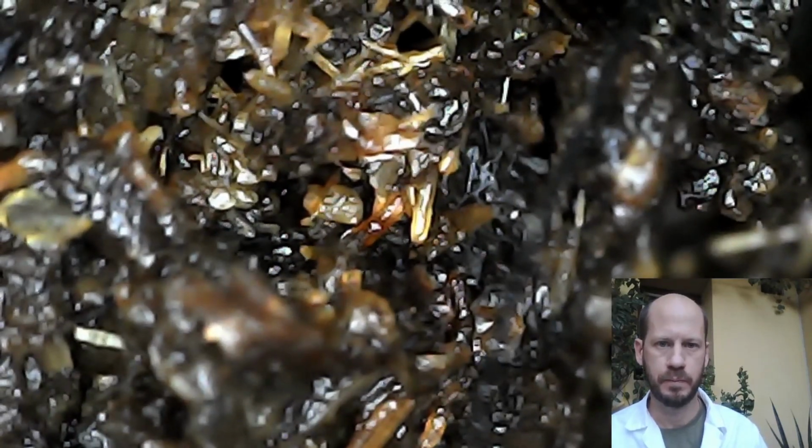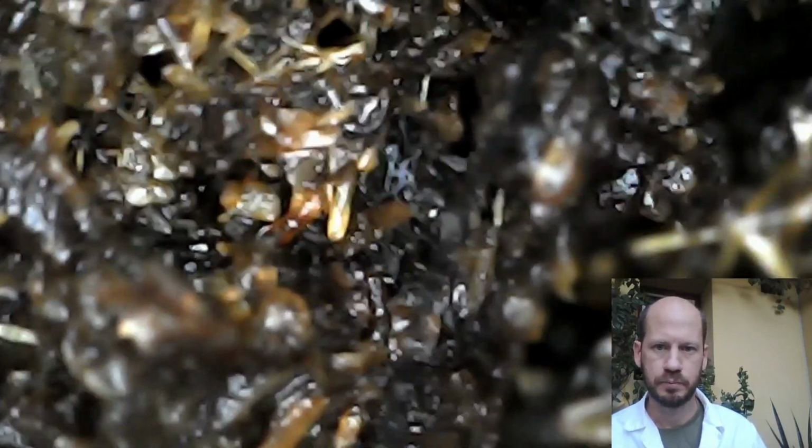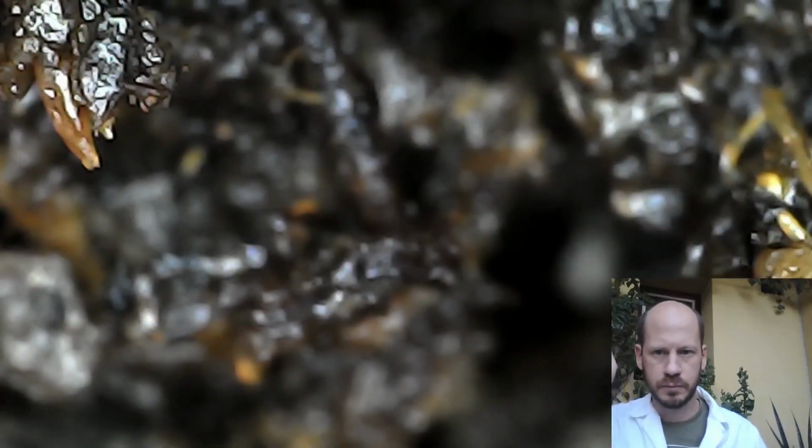And I will poke around here and try to find some life on this soil. You can focus up and down. There you go. You can see something moving there. Even nematodes you can see with this. Just move it around and see what you can find.